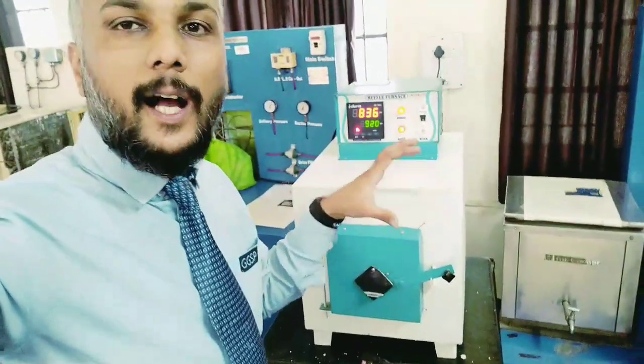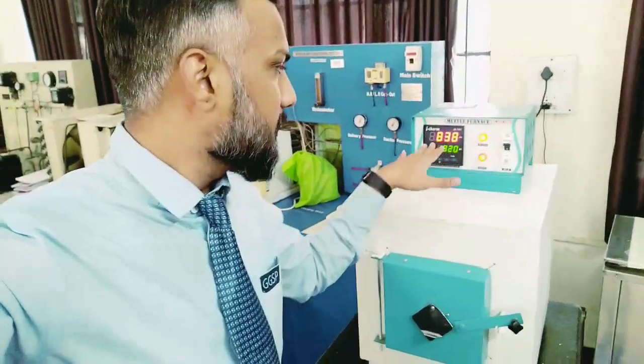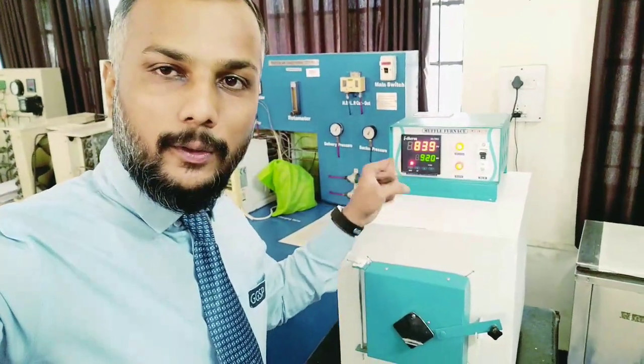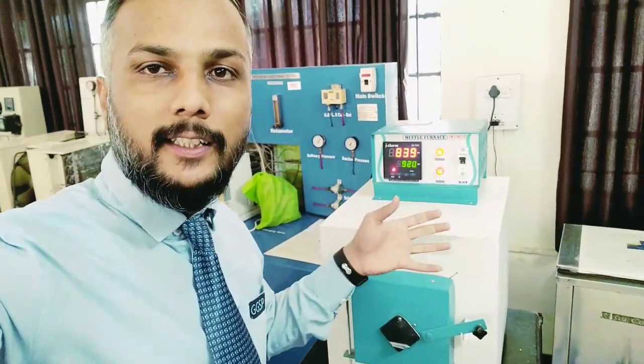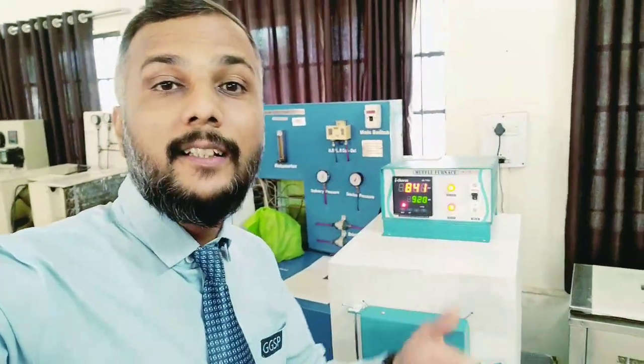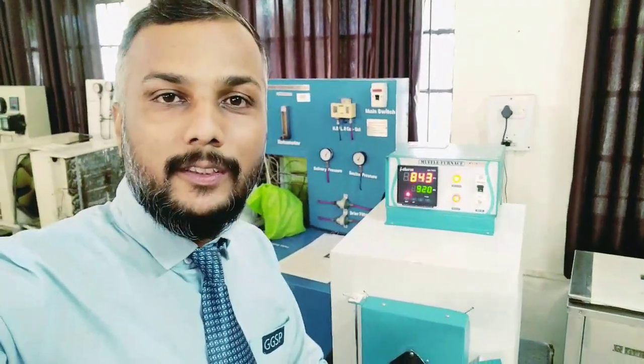Now we are going to see how the hardening process is carried out. You can see the muffle furnace has already started increasing the temperature. We have already kept the component inside, and now we are going to remove that component after it reaches the required temperature, then dip it in water to carry out the hardening process. After that, we are going to study the microstructure of that component — comparing the microstructure before and after heat treatment.